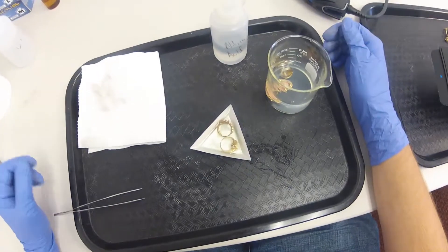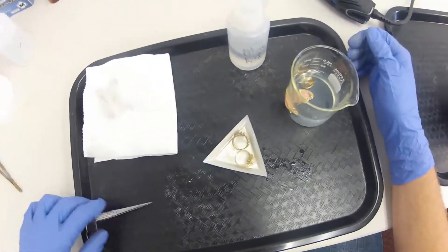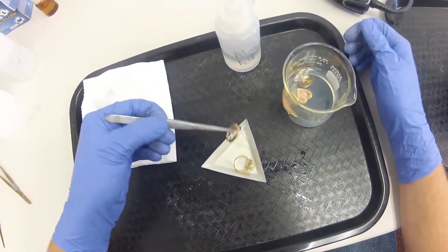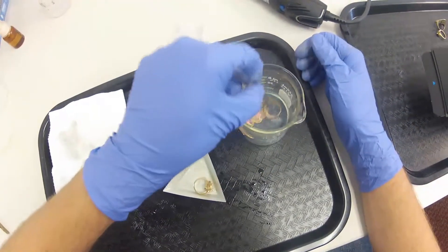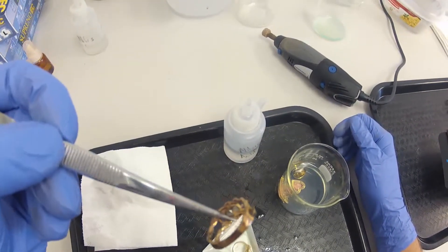All right, so it's been about 5 or 10 minutes, so I'll go ahead and show you the difference between the 10 karat and the 14 karat here. I'll get it rinsed off a bit. All right, so this is the 10 karat.